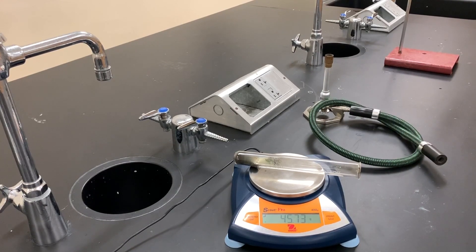Record that it's 45.73 in your data table. We'll subtract that from the test tube's mass, and that should be the mass of just our copper two oxide. Then we can move on to doing the stoichiometry and percent yield and see how well I did in my lab.